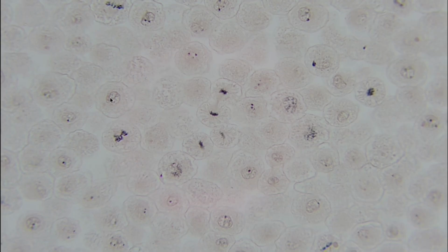So I'm going to point out a couple that I see here, right? We're going to have our interphase, our cells at work, right? We have that chromatin going on right here. I can also start to see we're going to have prophase, right? When we're beginning to condense that chromatin into chromosomes. I can even see here, this is going to be some really late telophase. Right, and we'll get into a bit more telophase tips here in a minute, but that's just a really great example to point out right now, I think.